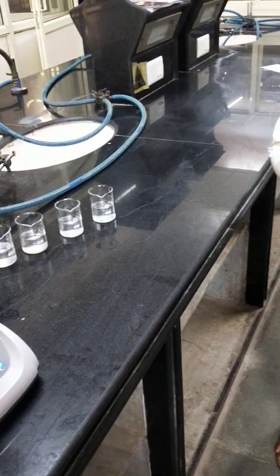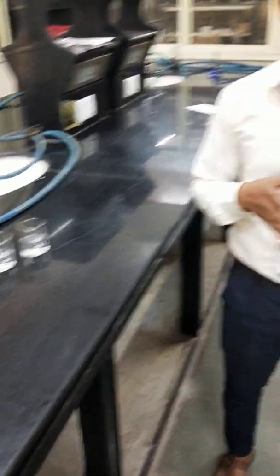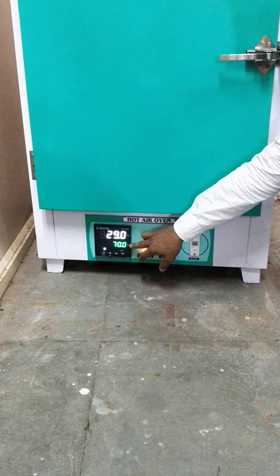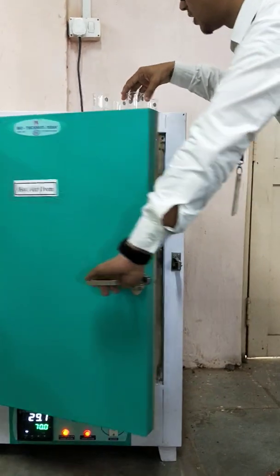Now we have the beakers with the 2%, 4%, 6%, and 8% solutions placed in the hot air oven for 30 minutes. The temperature is maintained and the evaporation changes occur in the upper area.